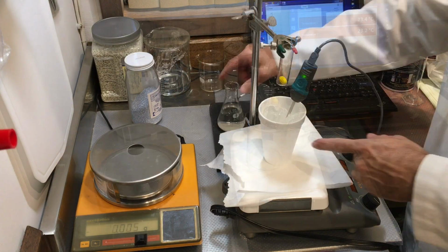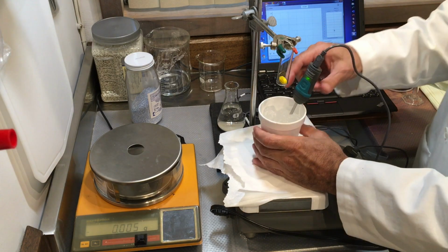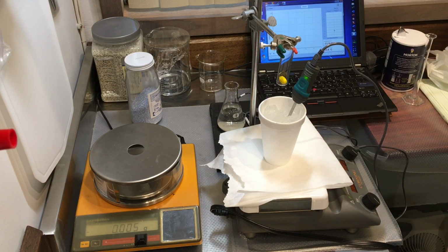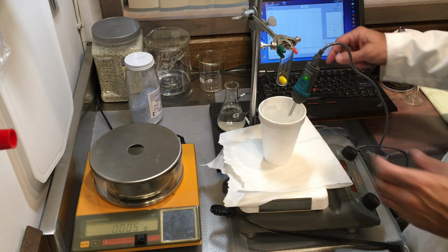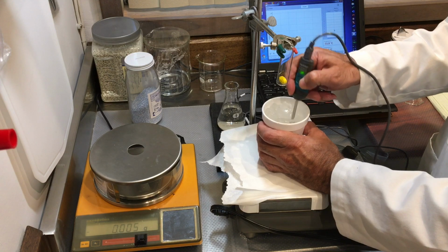And now I changed the beaker to a styrofoam cup, mainly because it does a much better job insulating. And with the beaker I was getting a temperature of 9 degrees, and for the solution I need a colder temperature. By just changing the container, I'm down to like -11, close to -12 degrees Celsius. That's what I want.